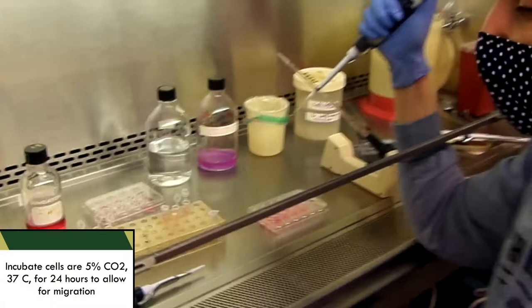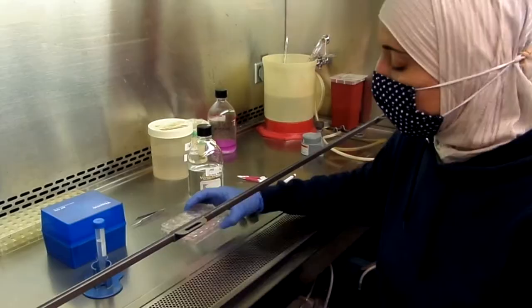We'll incubate the plate at 37 degrees, 5% CO2 for 24 hours.